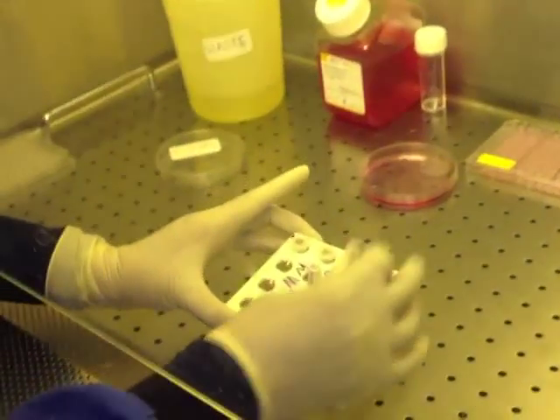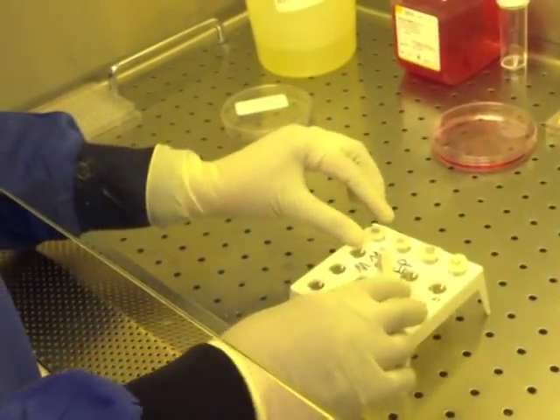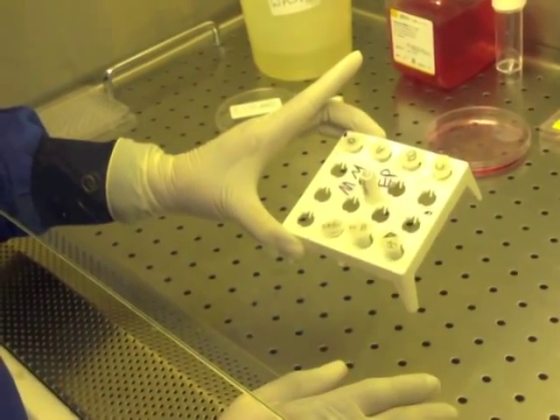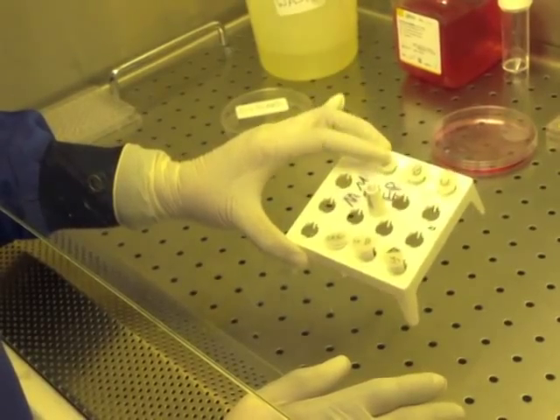All you need to do now is take your stock solution and make it up in your drugs with the diluted final concentration that you want in these tubes.